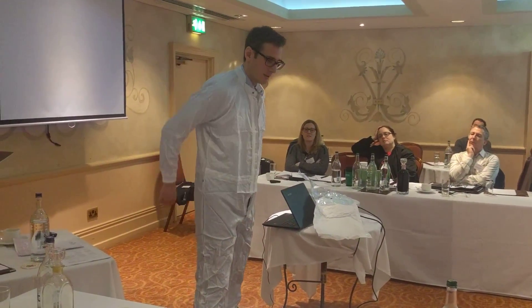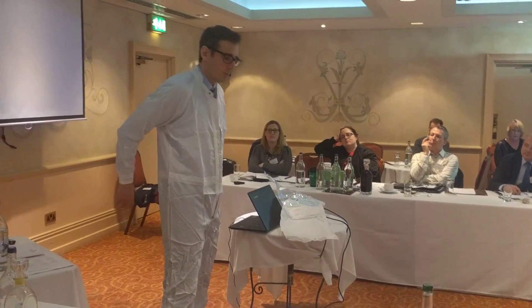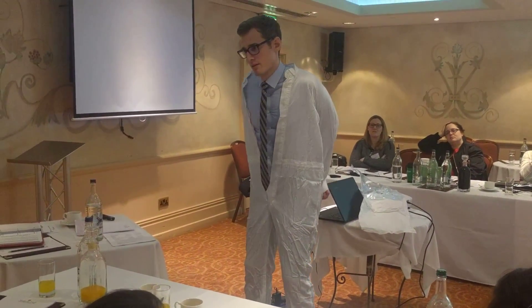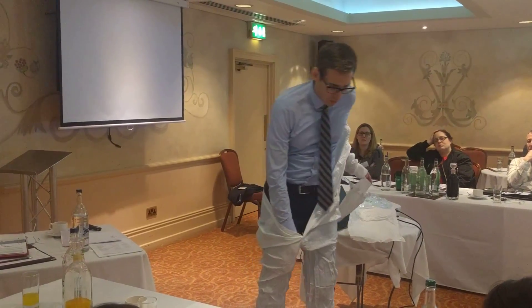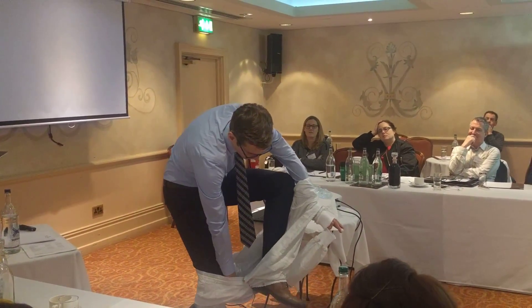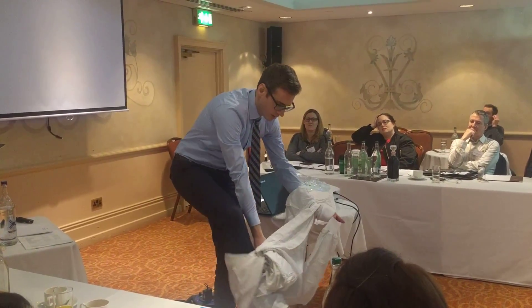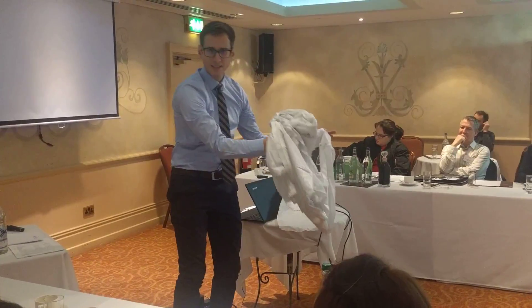I would open the overall, remove the first pair of gloves, then open the overall further. I try to take the overall only at the end of the sleeves and take control of what happens with the rest of the overall — getting it on the inside. Again, I have control of what happens with my legs and with my sleeves.